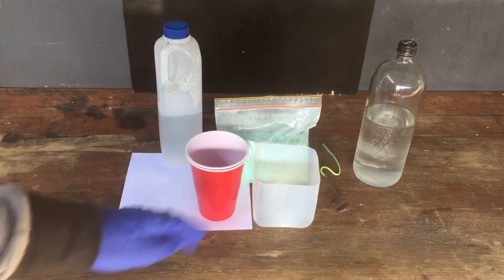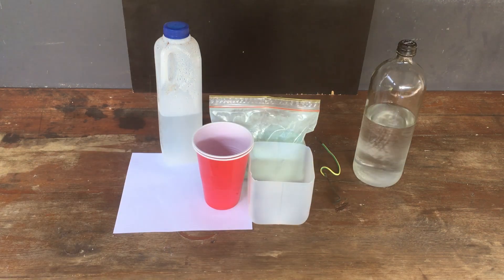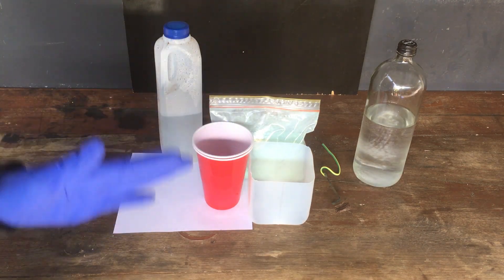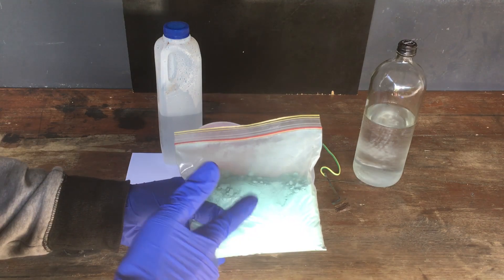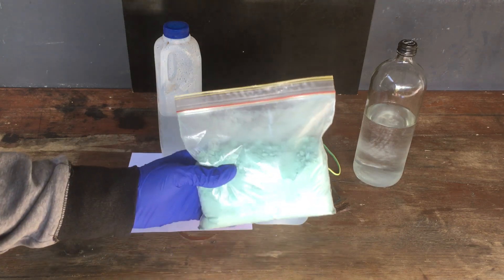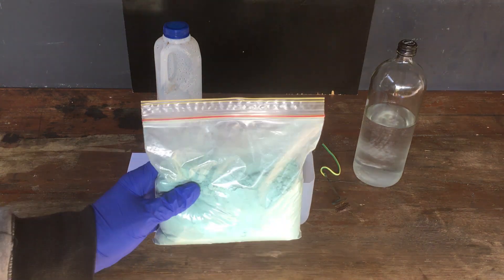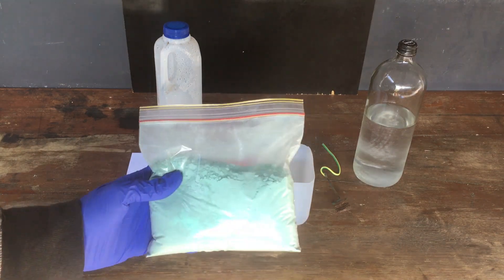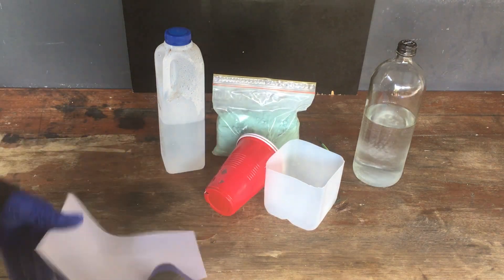We also need to hold the cell at around zero Celsius in order to stop any side reactions from destroying our product. In the anode compartment of the cell, we are going to need a dissolved copper catalyst in the form of tetraamine copper, which we're going to make from this copper carbonate, which I made in a previous video. This is actually what I do with all of my copper waste — I convert it into the copper carbonate form and store it. The thing we're going to be using as a diaphragm for this process is just going to be a regular piece of printer paper.